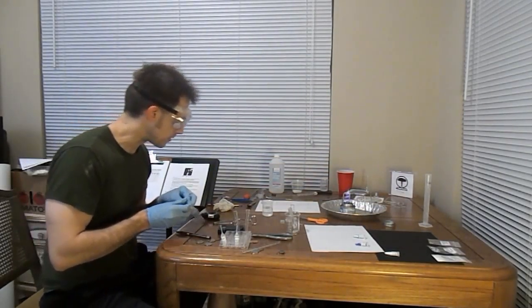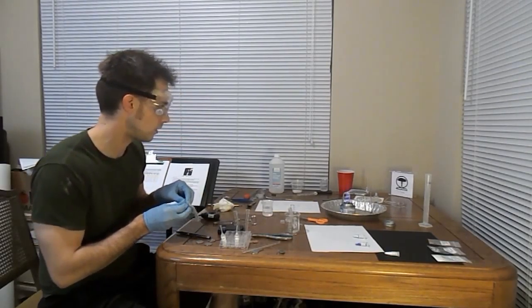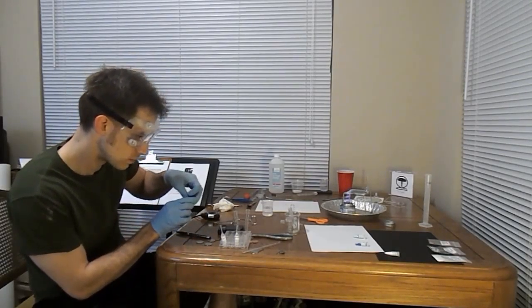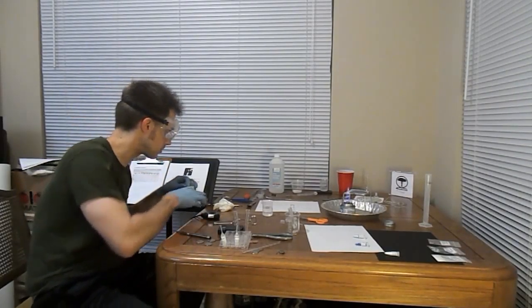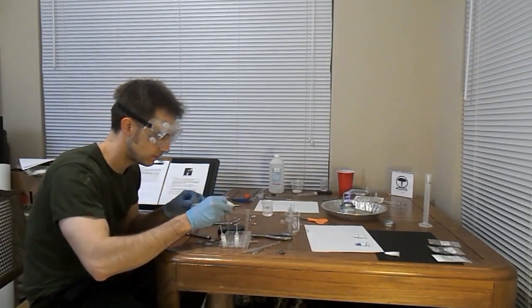The third thing we will do with this magnesium sample is add, while the letters say HCl, the tube probably says hydrochloric acid. It's corrosive. Be very, very careful when handling chemicals.